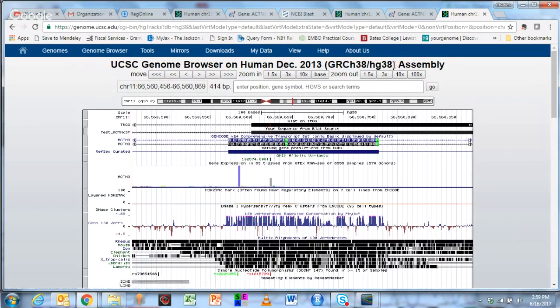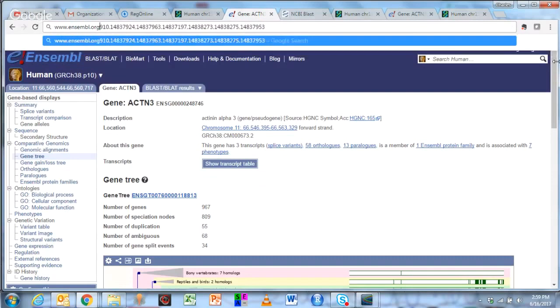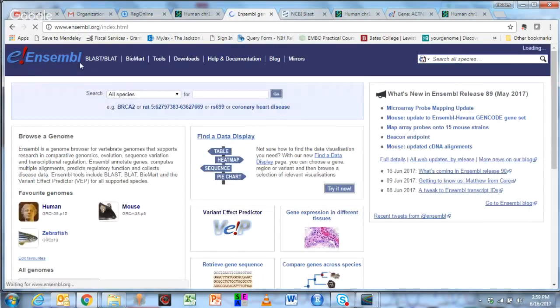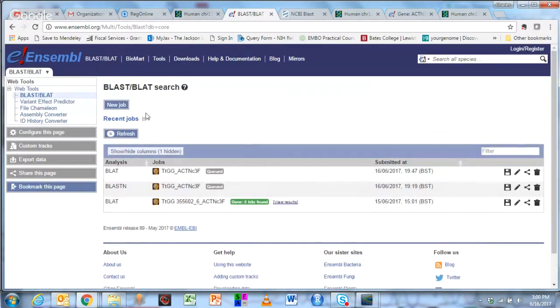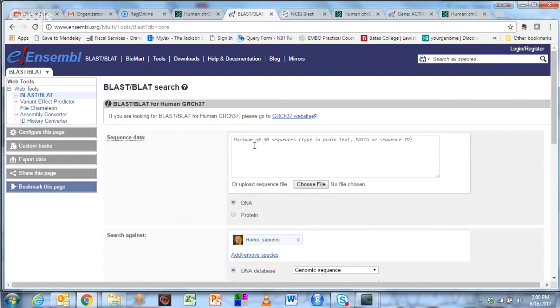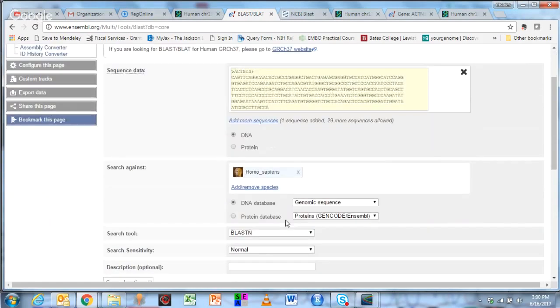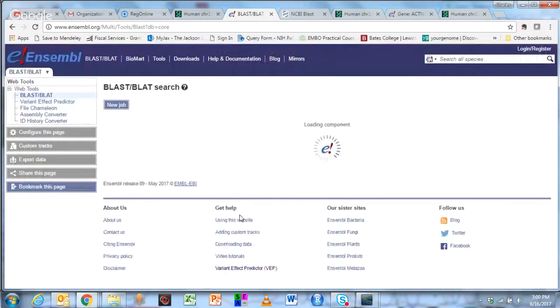Okay, so there's another way to look at it, which means we can do it in a genome database called Ensembl. I'm just going to go to the home of Ensembl, show you how to do this. You have to pick your genome, but we're going to do the same thing and go to BLAST/BLAT and do a new job. And again, we're going to put in our actinin 3 sequence, and it's DNA, and we want to do this as a BLAT for the first time. We're going to run this.